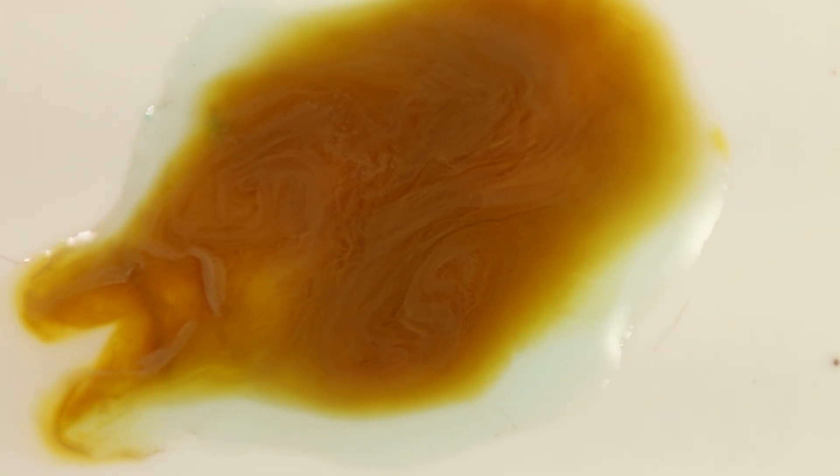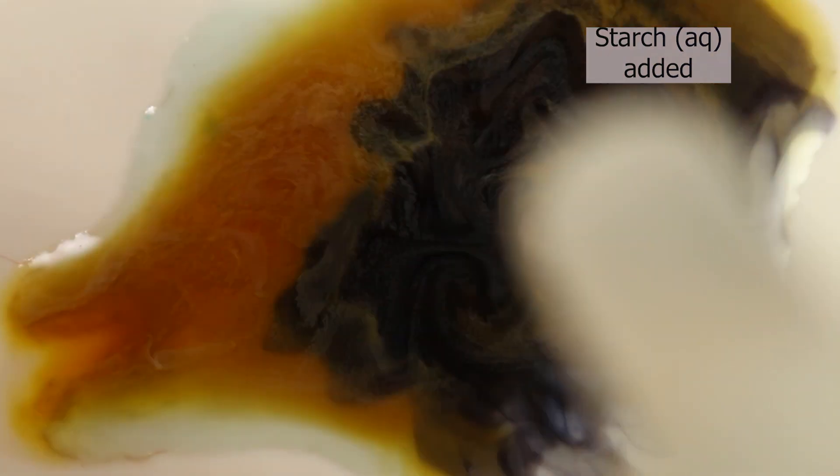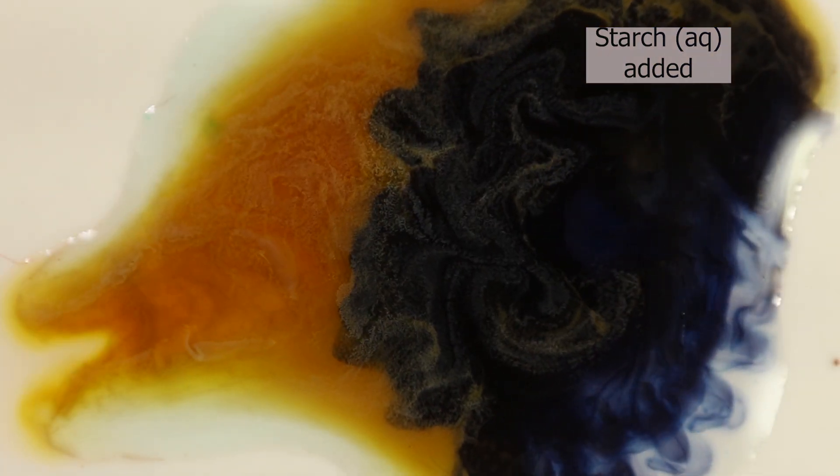Here on the microscale. And the addition of starch just confirms that iodine is formed, indeed blue solution.